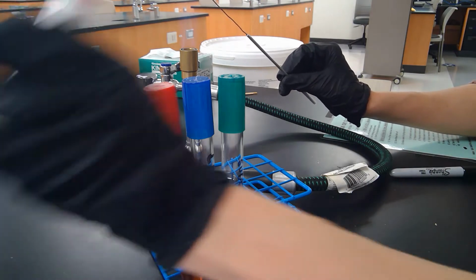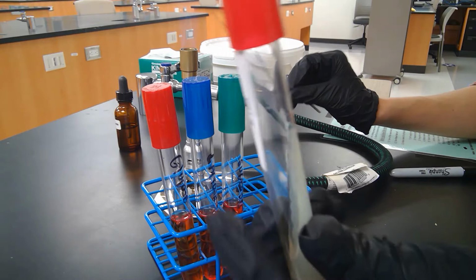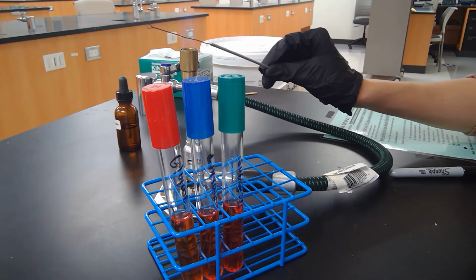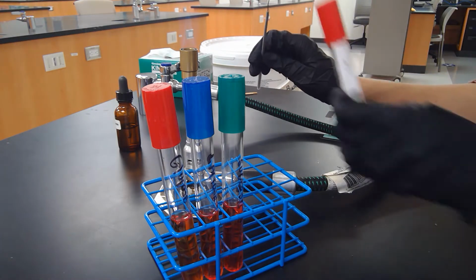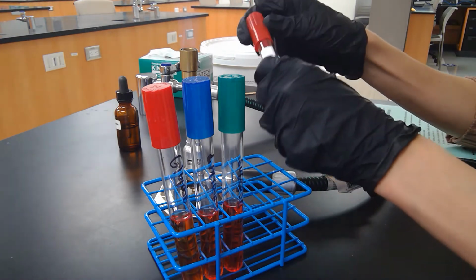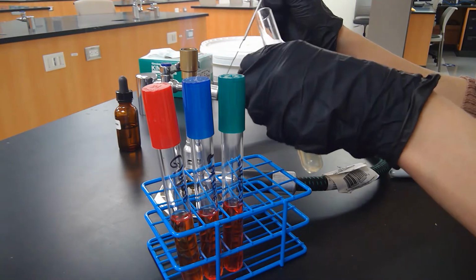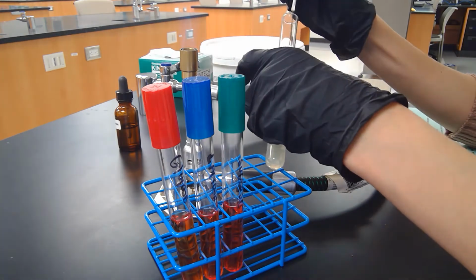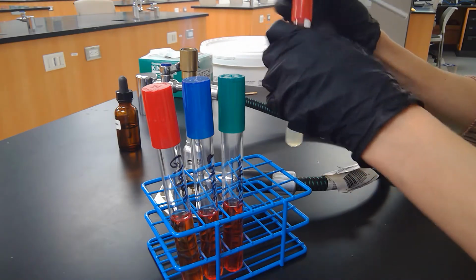So the first bacteria that I have is some E. coli that's already been growing on this nutrient agar slant. So I'm going to take a little bit of this on my loop. So first I sterilize my loop. Of course, I wait a little bit near the flame. And with aseptic technique, we're going to now take a little bit of this E. coli. And we're going to now put some of it into each of these tubes.